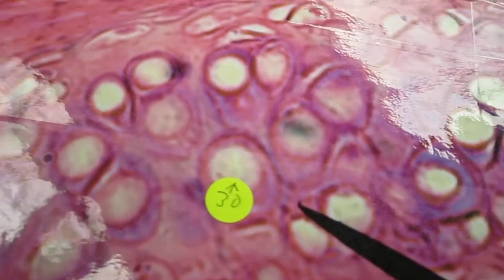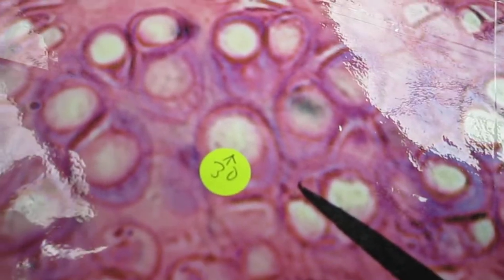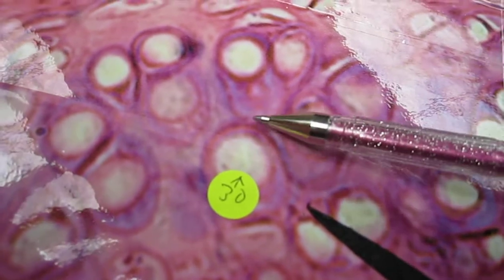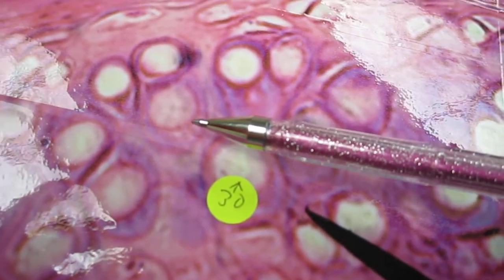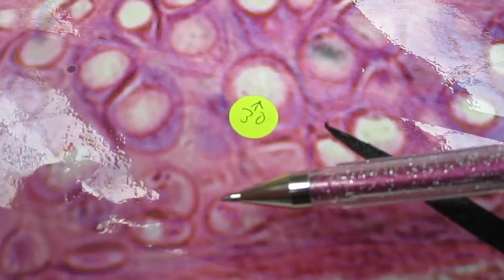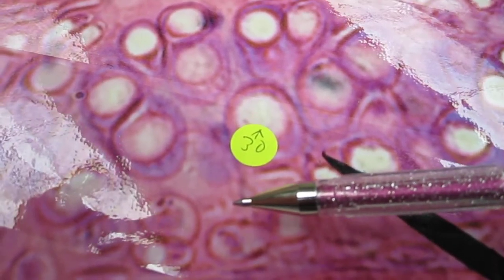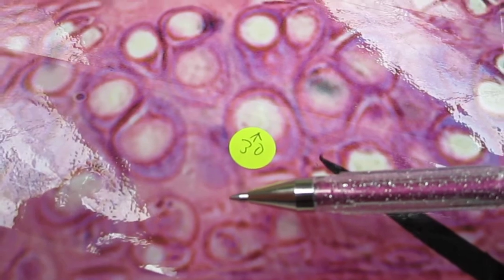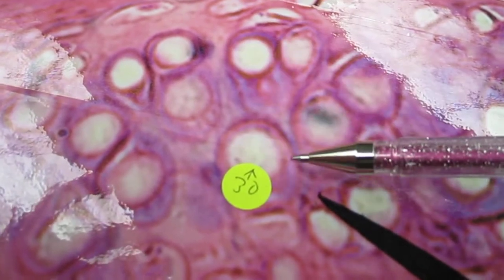In the meantime, nearby, not too far away, in the trachea, we're going to have this nice cartilage, which is of the hyaline cartilage persuasion, and that means that inside of each of these lacuna is going to be living a chondrocyte. Some of these are present, some not present. And we have, remember that the types of matrix here involved are ground substance that is no longer fluid, it becomes solid, and there's going to be more or less invisible or slightly visible little areas of collagen fiber.